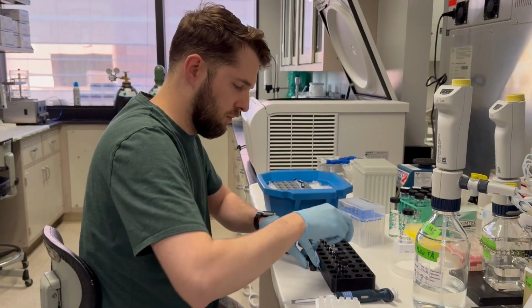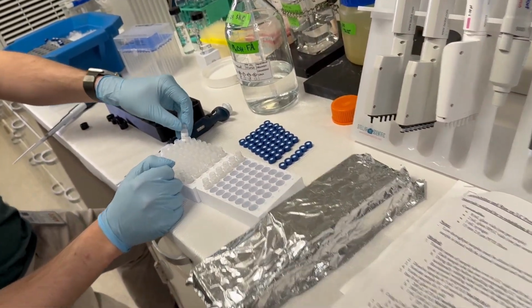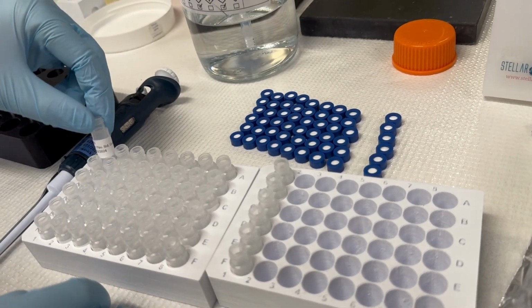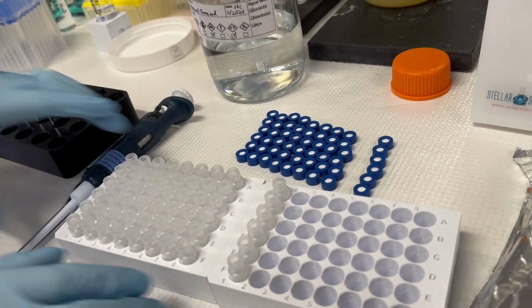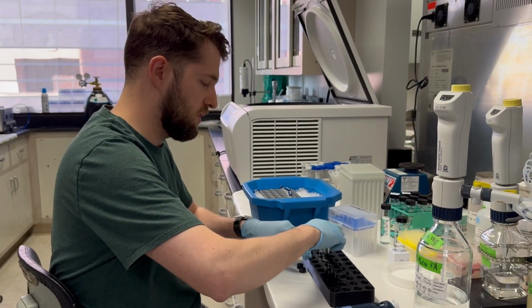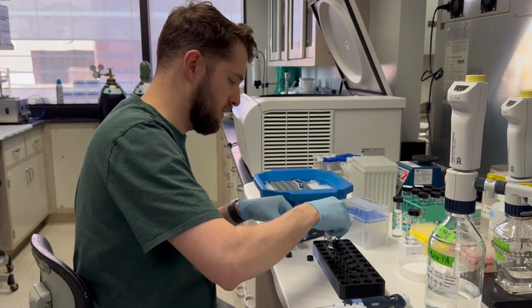One thing that I highly recommend doing in advance, and Alex, thank you for doing this, is getting your tubes set up ahead of time. Alex created a label sheet so that he could quickly label all of these tubes. We have 6 copies of the stock vial, and then 6 copies of the 3X vial, and so on. This process takes a little bit of time, and we have to run a standard curve every time we run a new batch of samples. So instead of doing this whole process every time, we can do this once, and then we get 6 runs out of it.